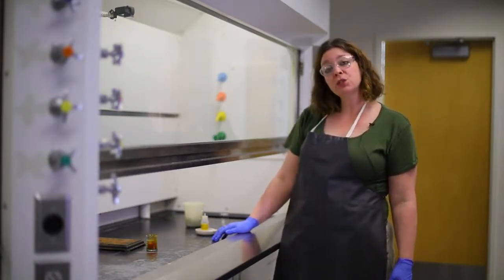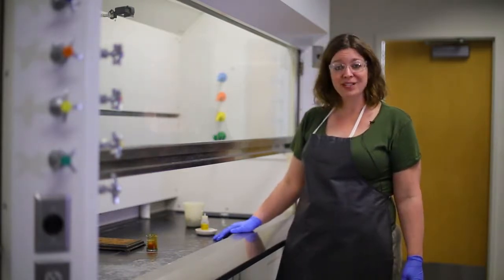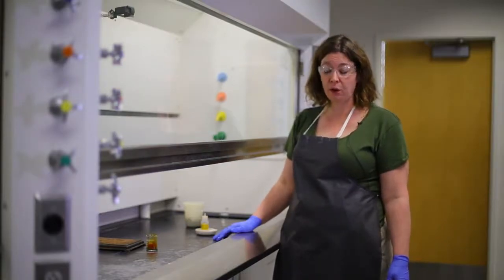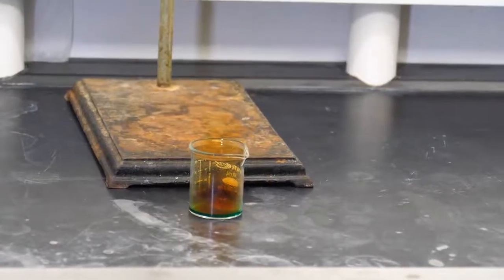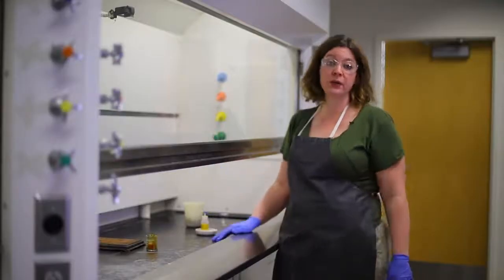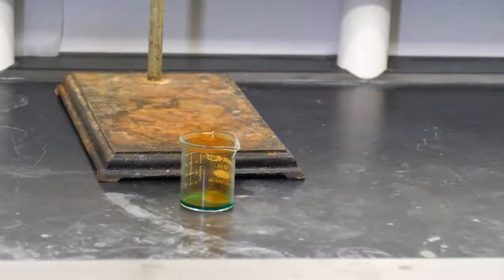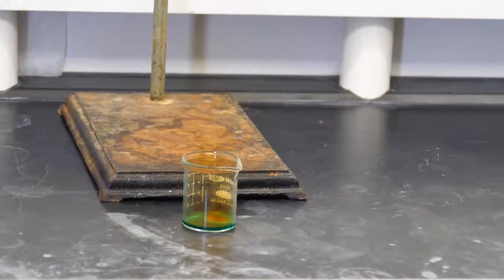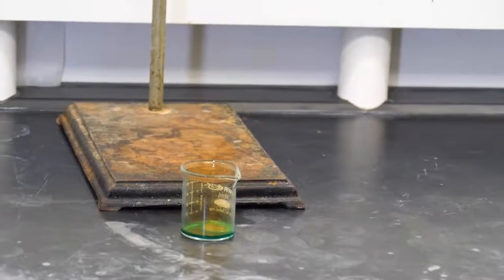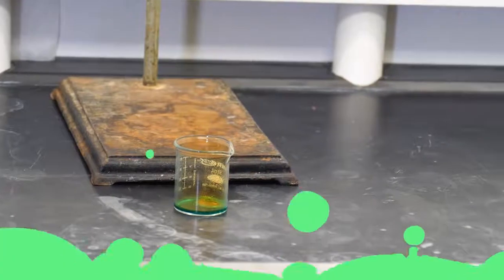We're doing this demonstration inside the chemical fume hood. You're not going to have this at your home or your workspace, so we're not going to do anything like this at home. But there are times when ventilation is important, and we're going to make sure that you understand why we need to do this in a ventilated space. This reaction is going to continue for a couple of minutes until much of the copper has dissolved away and until no more red-brown NO2 gas is given off.